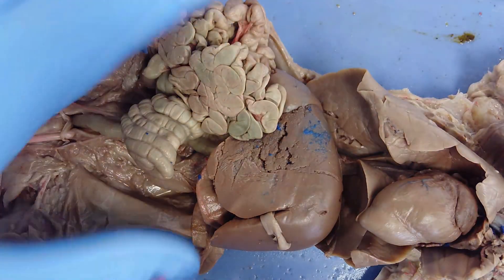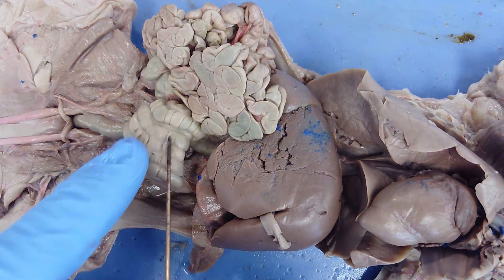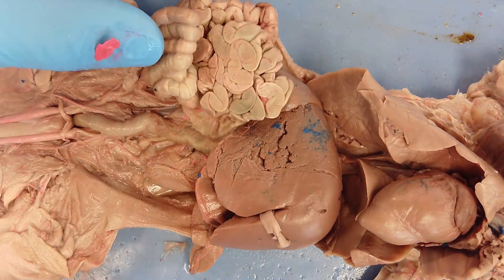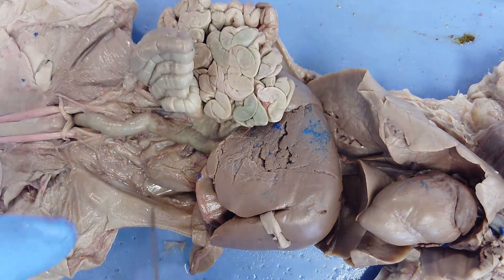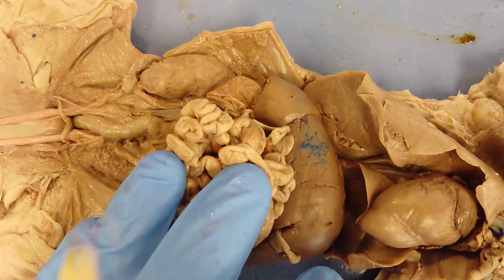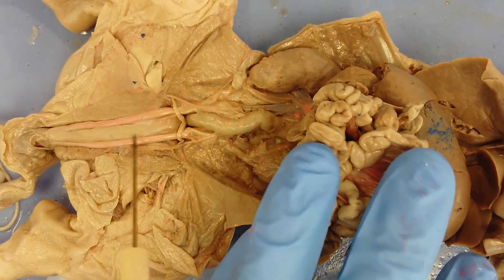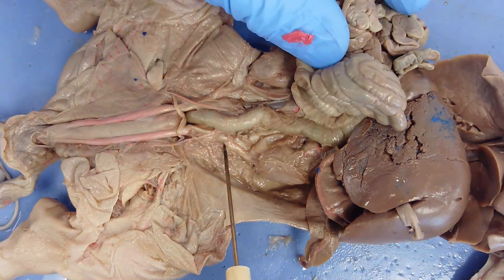Using a different pig to show additional features: reorienting, you can see the liver, spleen, stomach, large intestine, small intestine, and colon. A membrane covers a couple of other structures — the kidneys. There is one kidney here and another here. The kidneys are connected to the urinary bladder by a pair of tubes called ureters — one ureter on each side.